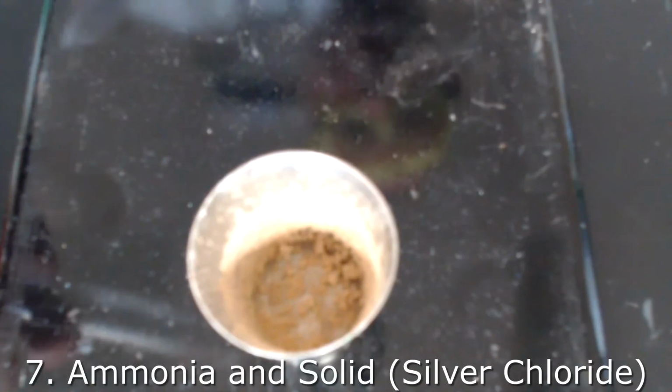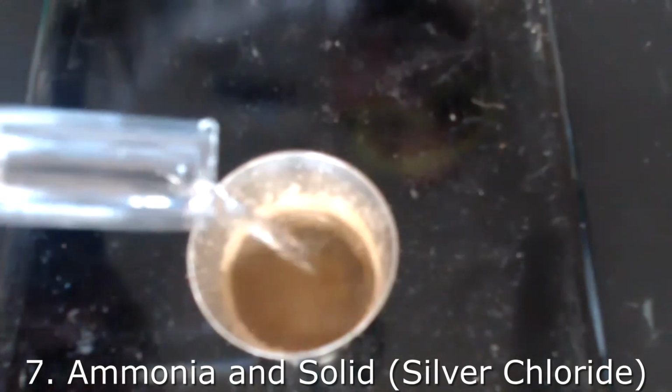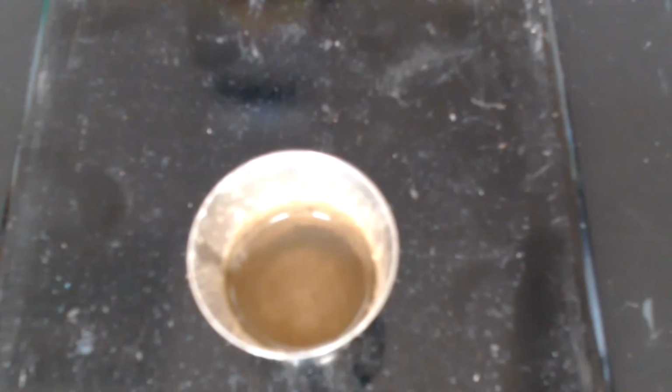At this point, our precipitate has cooled sufficiently. I am now ready to add the 15 milliliters of ammonia. You can stir this using a glass stirring rod.